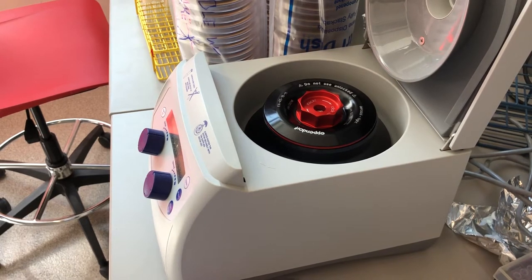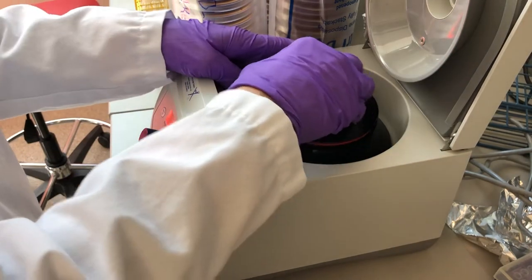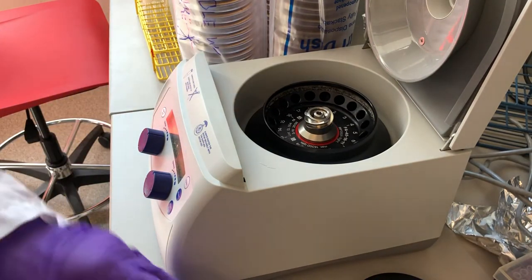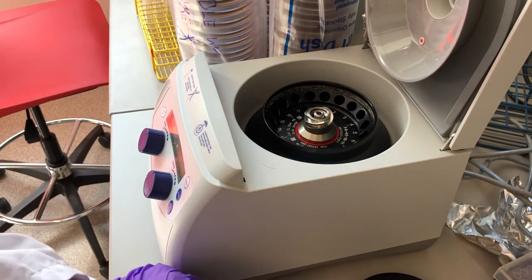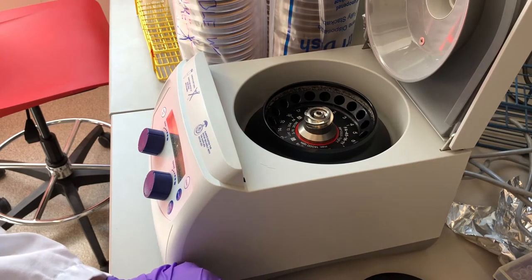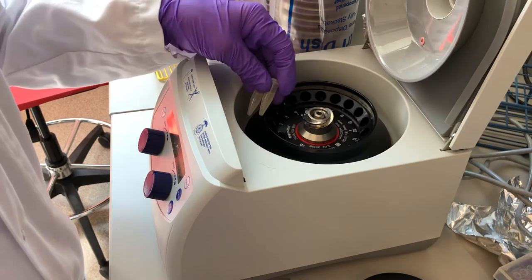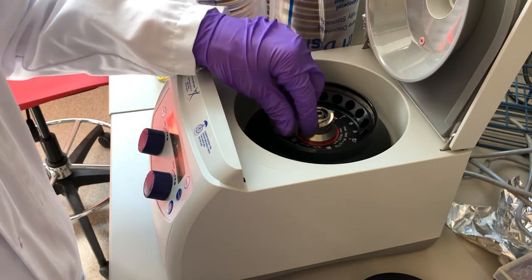Okay, harvesting the cells using centrifugation to isolate DNA. Open up the rotor. You need to share the centrifuge with three other students, so put your set of five tubes starting at a multiple of six.